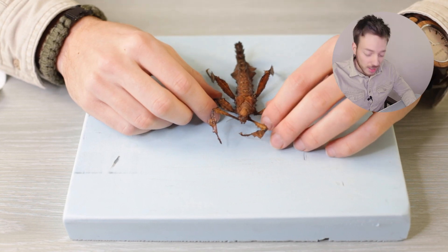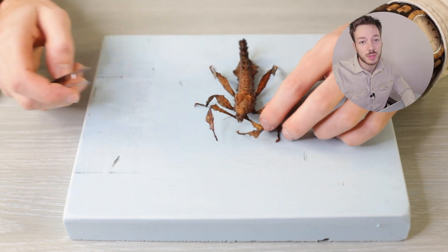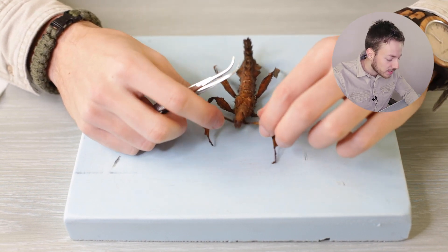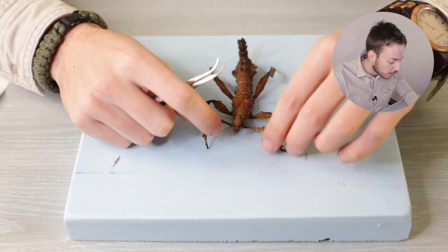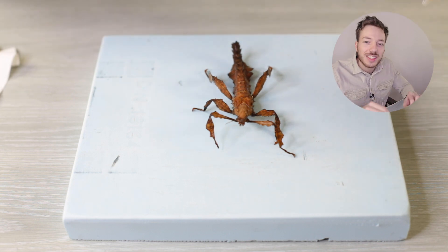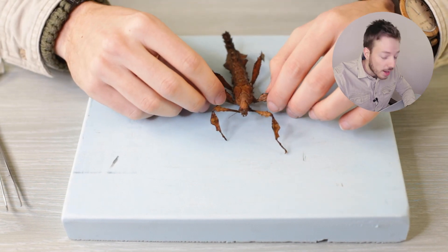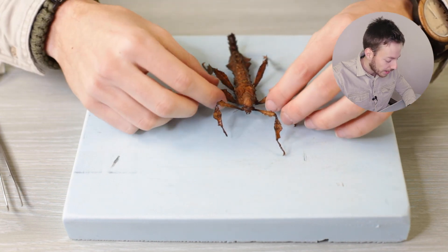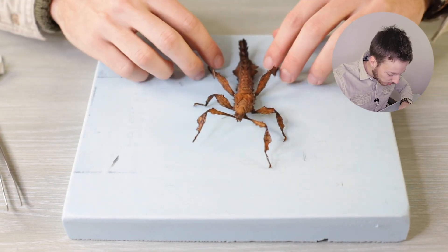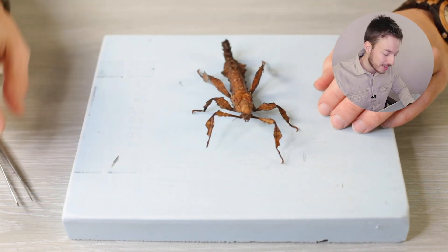One of the things you might stumble upon is that the insect has stiffened a little bit, and that's very common — it just happens to dead animals. Particularly insects, because they have a hard external skeleton and their joints are covered in membranes. When the insect dies, those membranes harden, which makes it harder to get the insect in the right position. That's why you use pins to put all the little appendages and legs precisely the way you want. You can try to loosen those joints by using some alcohol or putting it in warm water to soften the membranes. This one has been soaking in alcohol for quite a bit, which has stiffened it — but that doesn't matter, we'll use pins to put everything in the right position.